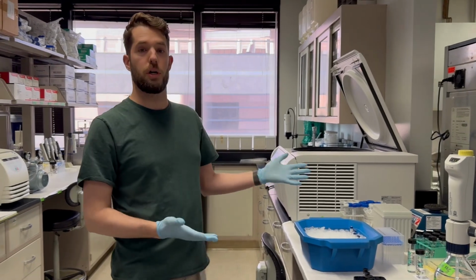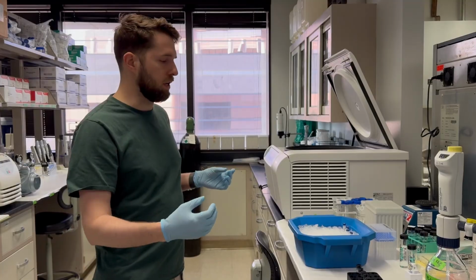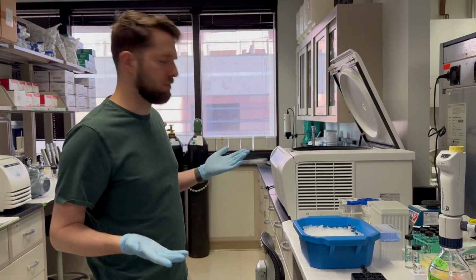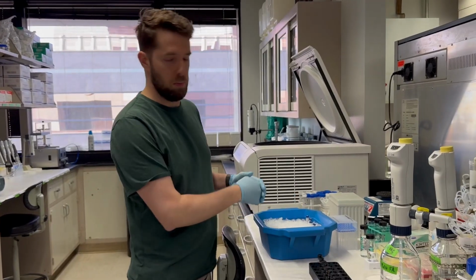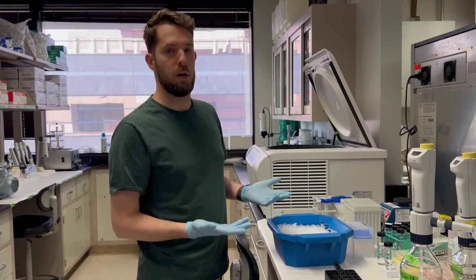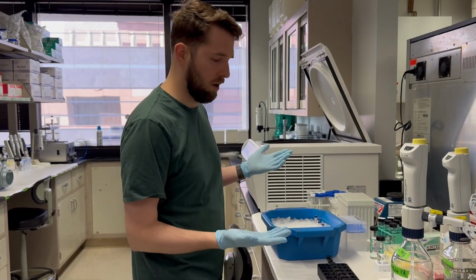What we're going to do is mix these together, because you could have a standard curve for each analyte, but that becomes too complicated at a certain point. So we make a cocktail out of them, with multiple together, because our analytical method is able to separate each molecule, so we can run them all together.